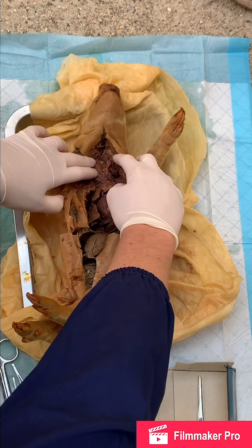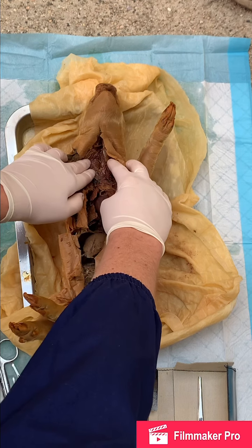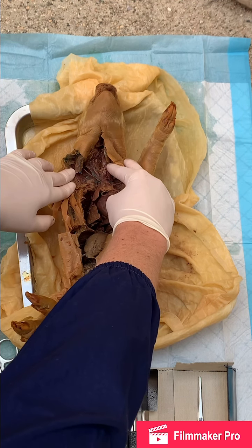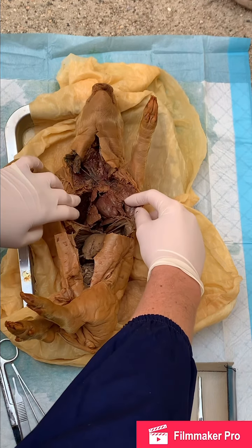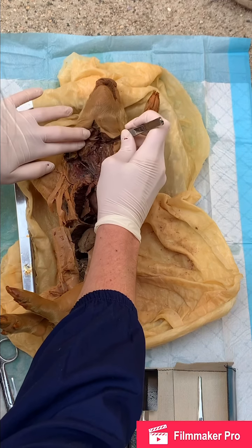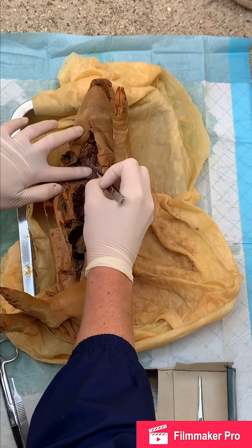There are C rings of cartilage in the trachea. The trachea is also anterior to the esophagus, and it extends from the cricoid cartilage of the larynx to the 5th thoracic vertebra. This then would divide into the left and right lungs of the pig. So as it's here, let me pull this back. Right here is where the air would go. You go down here and the air would lead into the lungs.